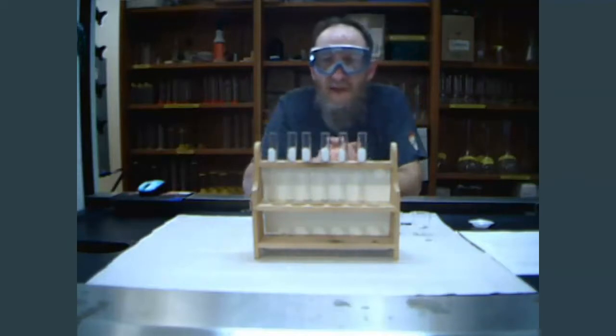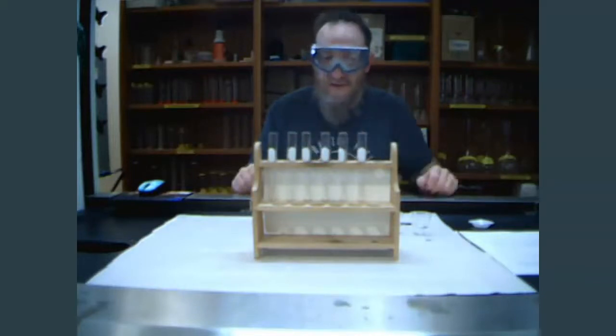I have six test tubes set up and we're going to look at the interaction between the solid metal and the aqueous metal and figure out which one is more reactive or less reactive. And from that, create what's called an activity series.